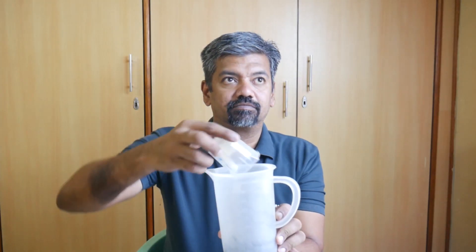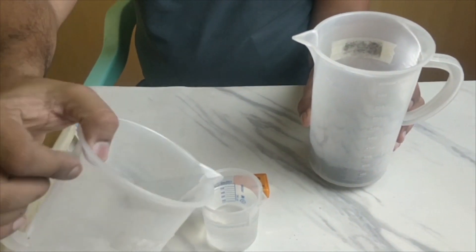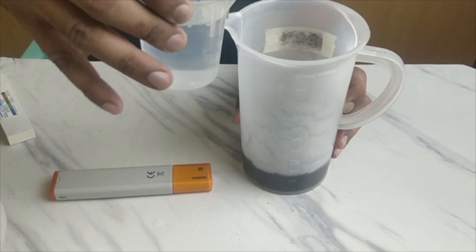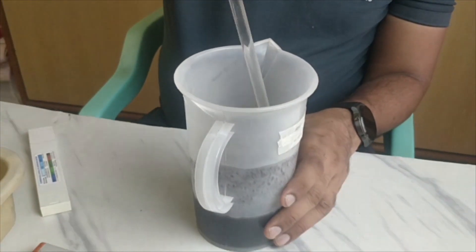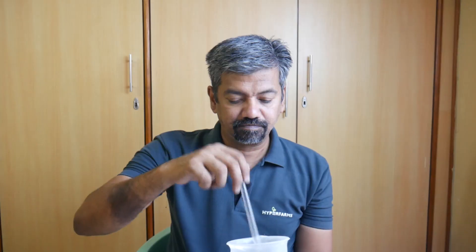I've added the cocopeat and I'm going to add another 100 ml of water and pour it in. You will see a slurry of salts. You can simply mix it with a good circular motion, or if you find that difficult you can use a glass rod. Now we leave this for about 15 to 20 minutes for it to settle.